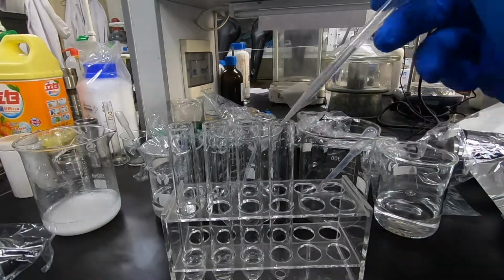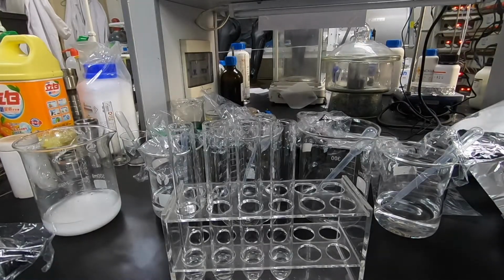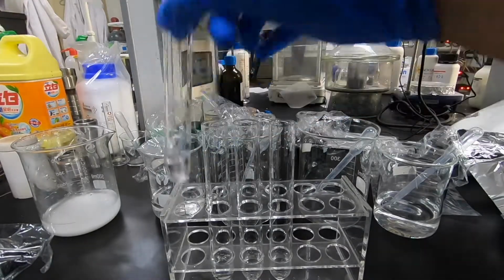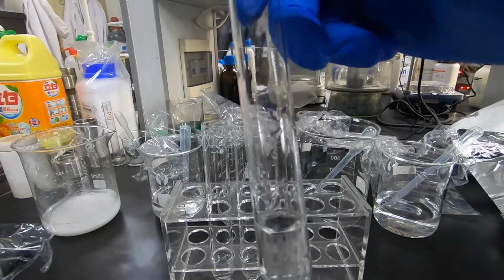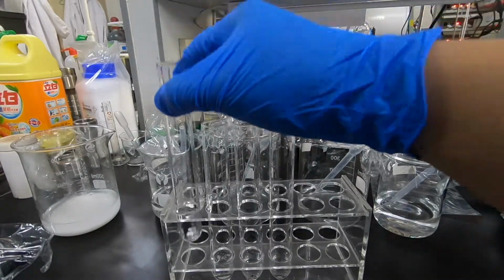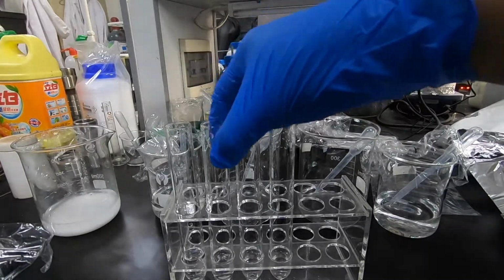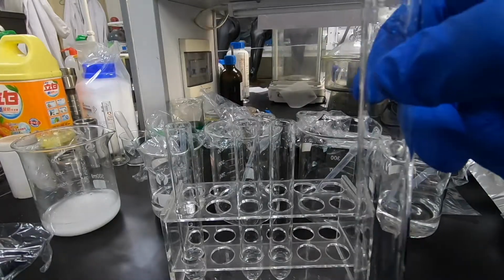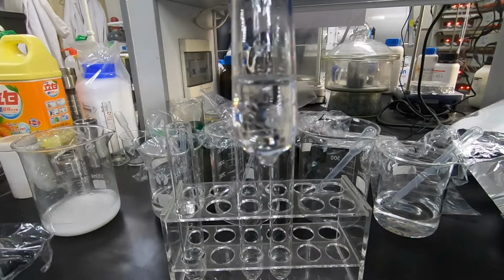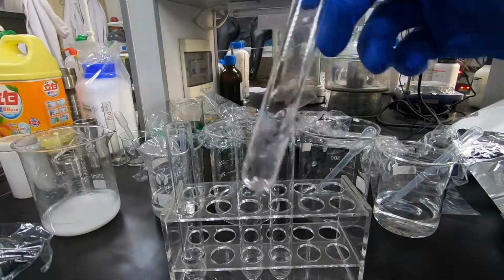A great way of repeating the experiment and recording all of the data is that you can compare the data at the end, so you can see which solution is which substance. So solution number 4 has no reaction with solution number 1, and also no reaction with solution number 2. In fact, it has no reaction with all of the solutions.